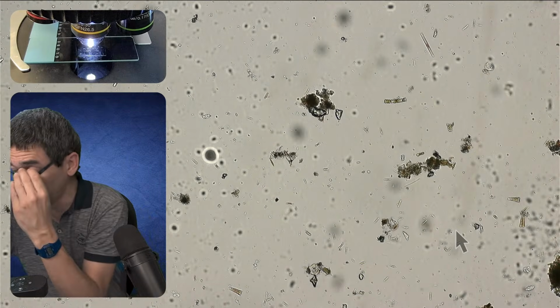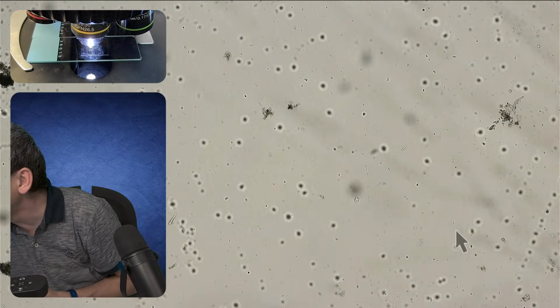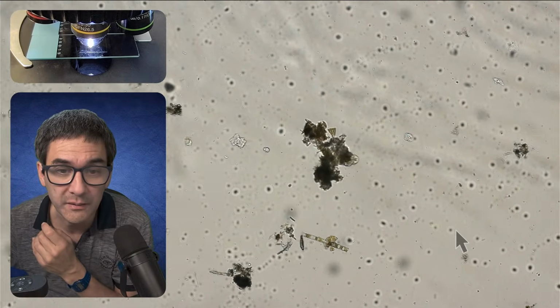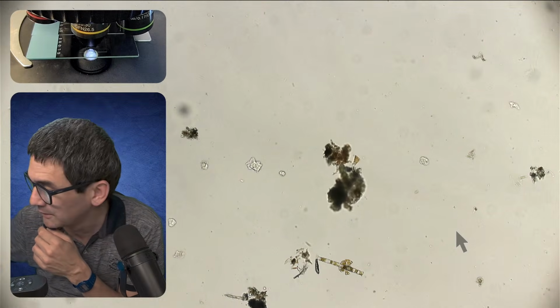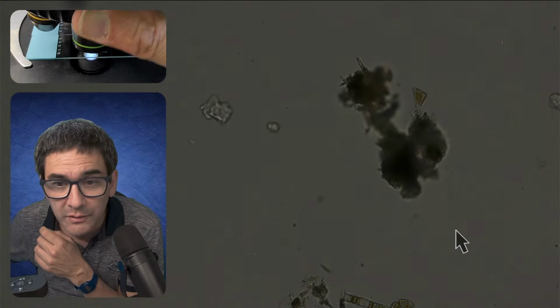So this is normally the time when I would look directly through the microscope eyepiece. Oh, we were lucky. Look, this actually was faster than anticipated. And because I have a cover glass now over it, I can actually go up with the magnification.